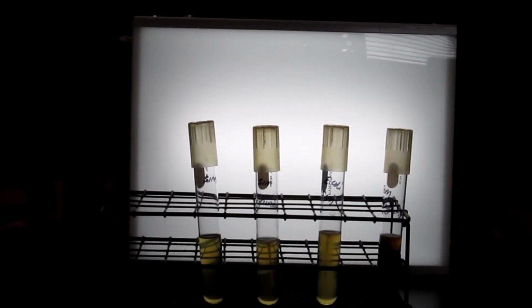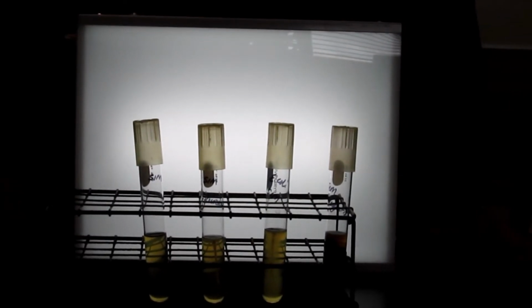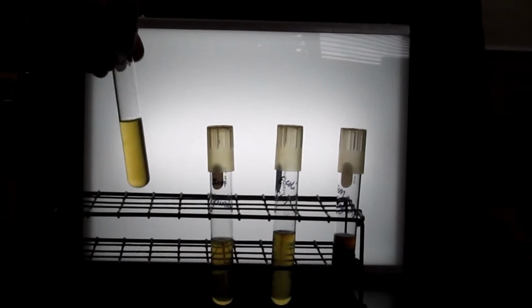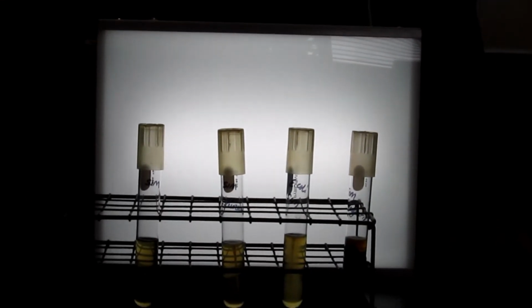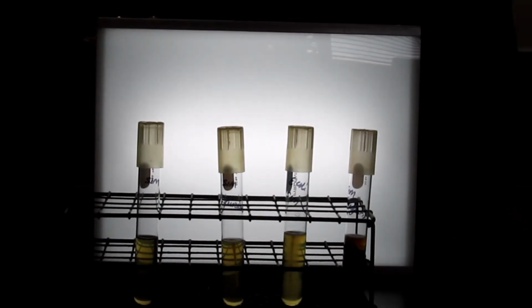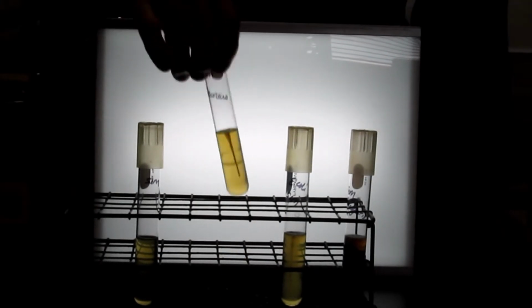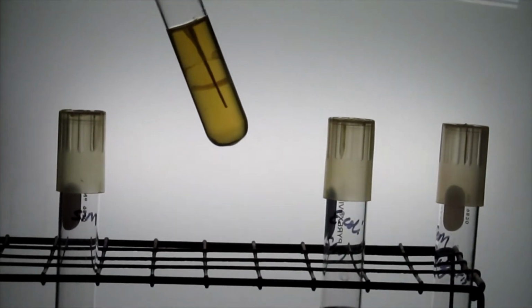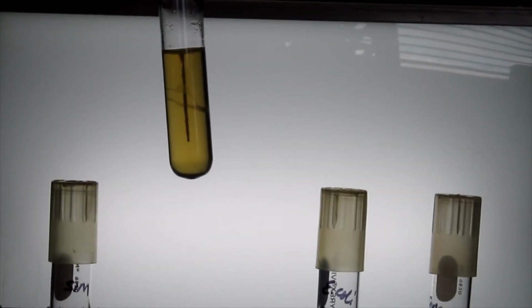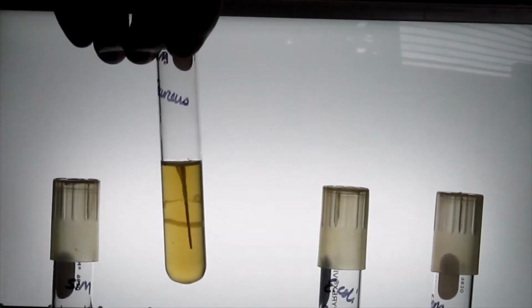So now we're going to see what kind of information you can get out of inoculating a SIM media that looks like that to start with. So one phenotype you might see is whether or not the bacteria can swim away from the area where you inoculated. And we have an example here where the bacteria has no motility. It does not move away from the inoculation line. You can see that it only grows exactly where the wire went into the media, and there's no growth away from that particular inoculation.